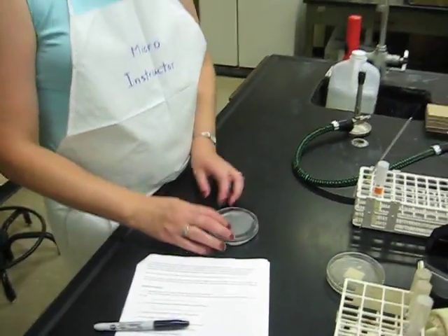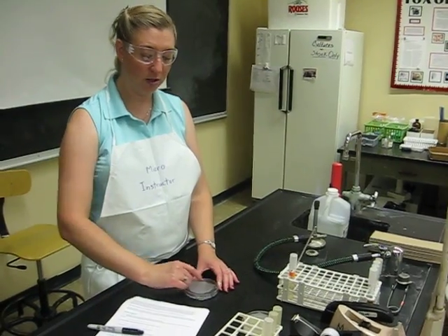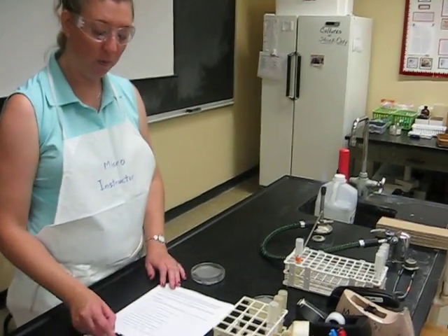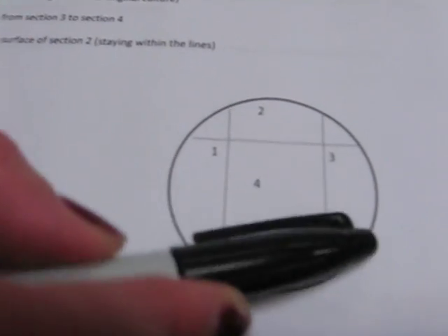I'm going to flip it over, decide which way I'm going to go. I'm probably going to start here, just like in the diagram. One, two, three, and then four.